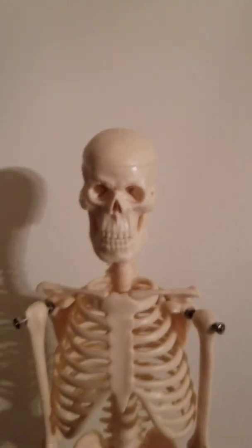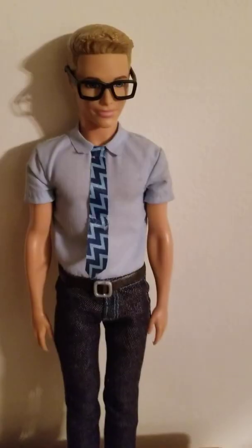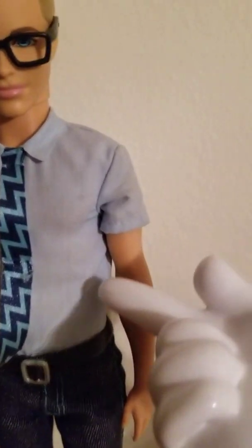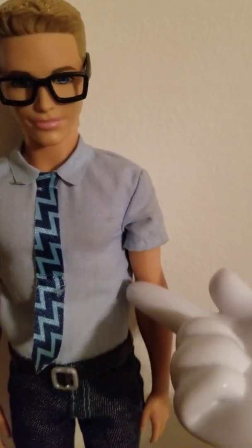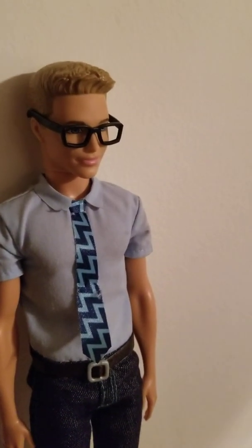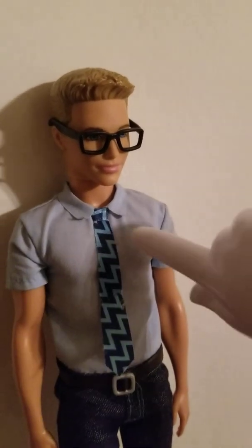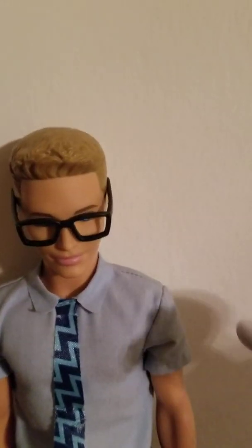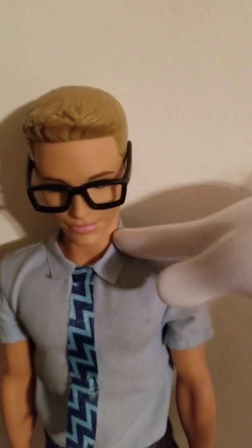I'll move over to Ken here for some of the muscles. Let me switch for that. All right, let's cover the muscles here. External abdominal oblique muscles being on the side there. Rectus abdominis muscle. I hope we get that in frame. Sternocleidomastoid muscle, right there. And then make sure I get the last one, your trapezius muscle. Trapezius is going to be right there. And making sure that's everything on my list there.